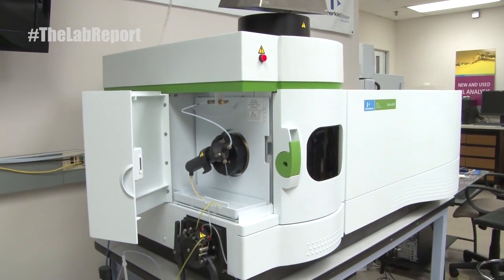Good water. Ever wonder what's in your water? Well, different elements, when in solution, have characteristic colors to them. Copper has a characteristic blue color, and that's because most of the red portion of the spectrum is absorbed, so we see blue. We're going to use this general principle to analyze different types of elements in different types of water samples using different types of analytical technologies. Hello and welcome to The Lab Report. I'm your host Paul Krampitz and today we'll be talking about the analysis of water using an ICP plasma spectrometer.